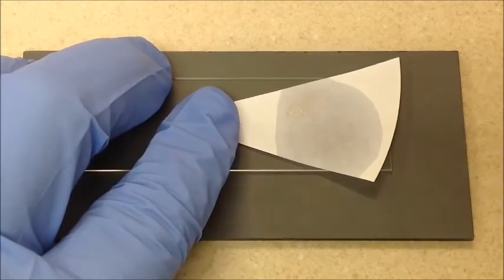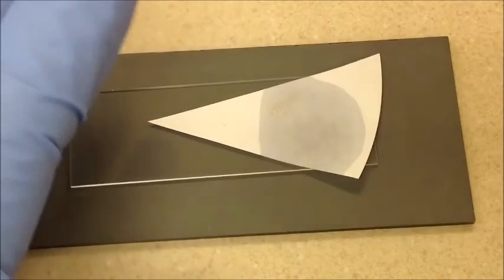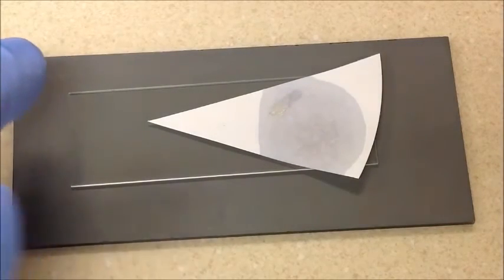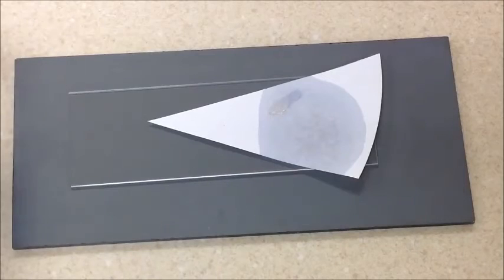Got about five seconds left here. I can see there's a little color change, but that's not a positive.